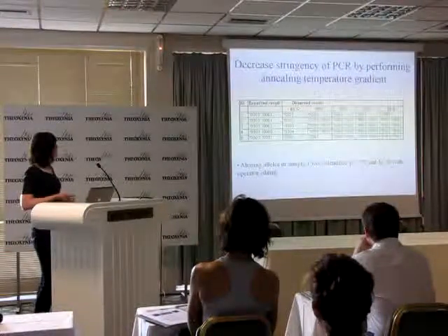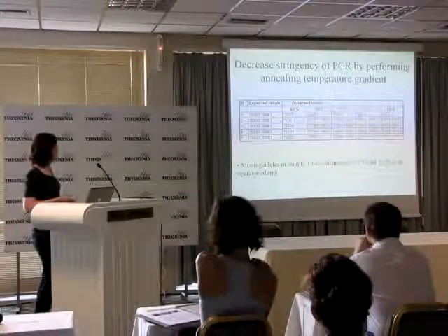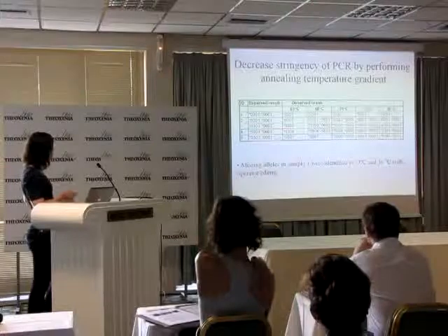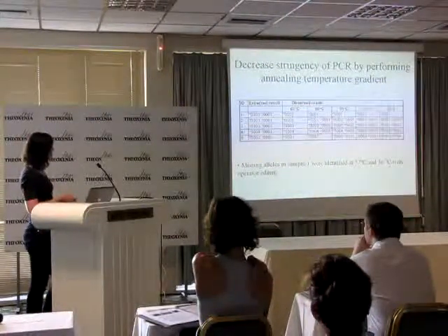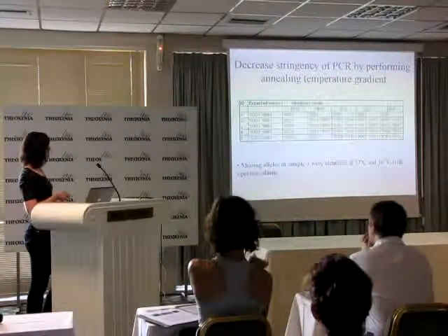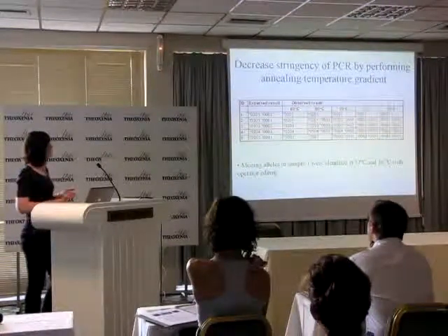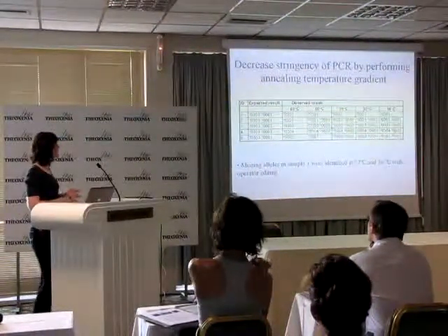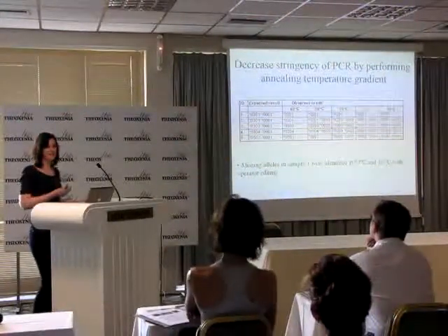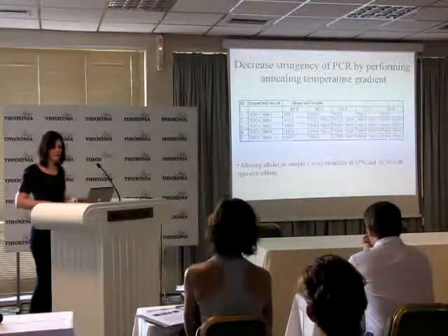So the next step was to decrease the stringency by changing the annealing temperature. So I did a gradient. This is what it was at the beginning, at 62, and I've decreased down to 56. And I'm still having a problem with the 0201, 06, 02. I did want to make the note that at 57 and 56 degrees I could get 06, 02, but I had to do operator editing. And as I mentioned at the beginning, we don't want to have to do that. That's not part of our QC for our sequencing.